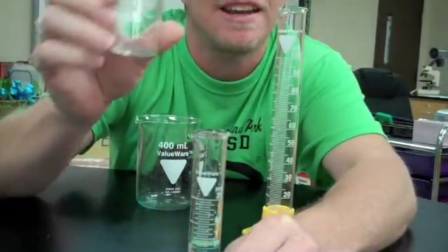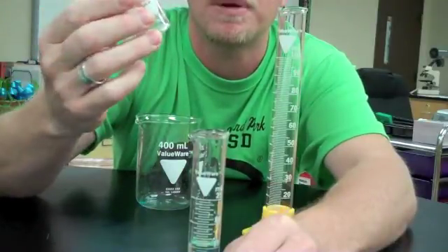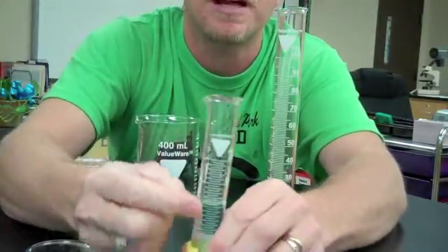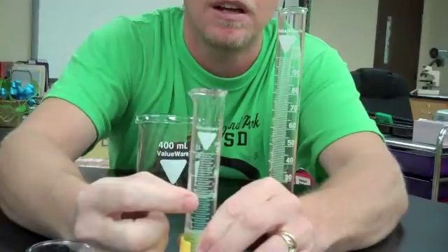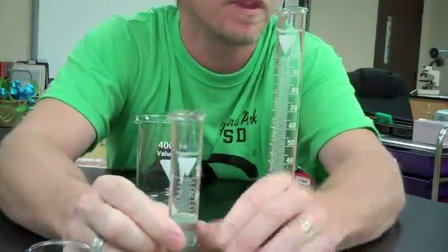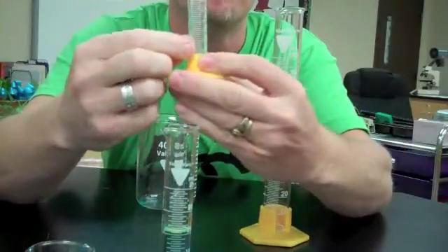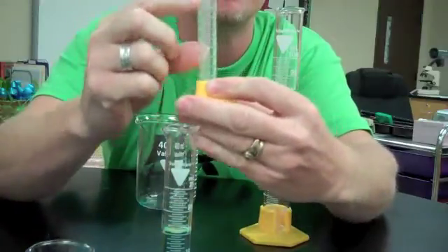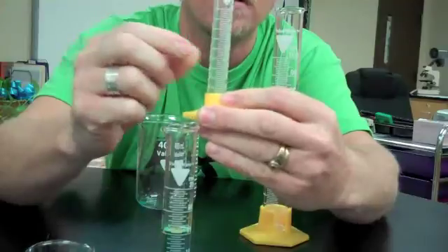Now remember, we had to guess with the beaker, and we said it was about 15. It could have been less, could have been a little more - we really didn't know. But with this particular graduated cylinder, because of the extra lines representing more accuracy and more precision, we can have a more precise measurement. Had we had less than 10 milliliters, remember the small one measured to 0.2 milliliters, which is better than 0.5 - so that one would have been even more precise and accurate.